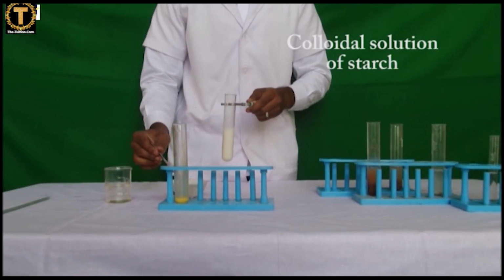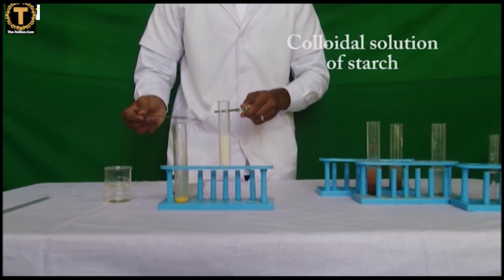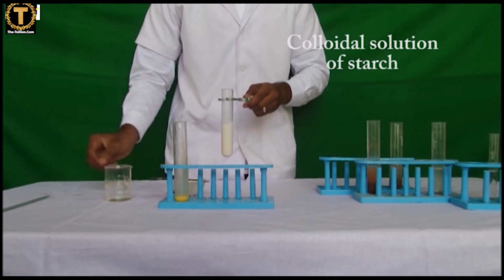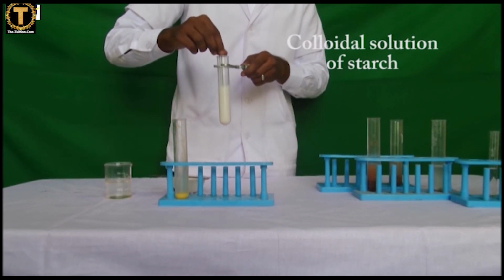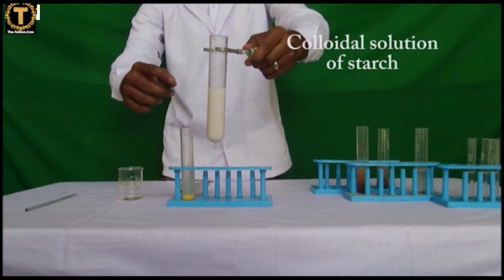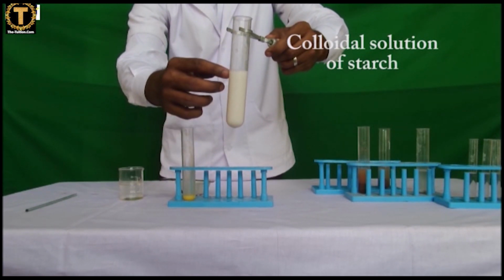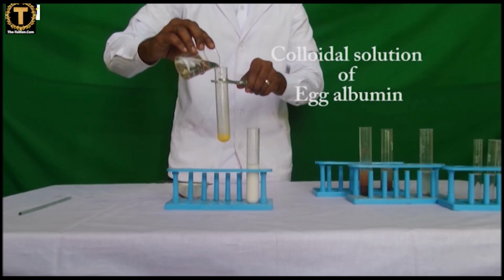C. To prepare colloidal solution of starch, egg albumin in water. Colloidal solution of starch in water. Now take 5 to 10 ml of hot boiling water and pour the contents in the boiling water. Allow the contents to cool. Record your observation.